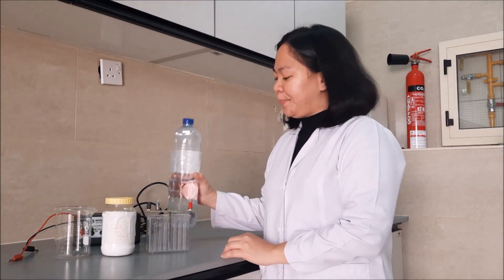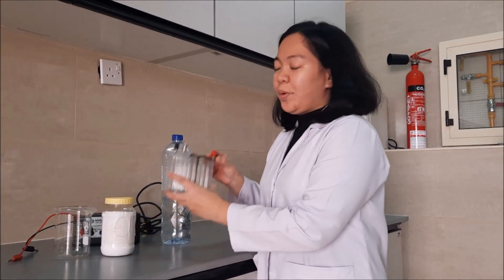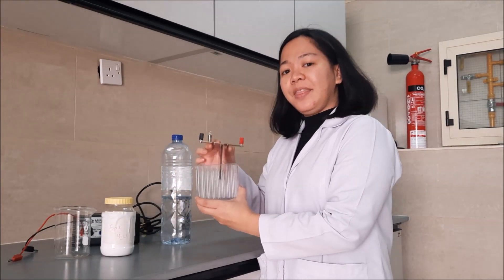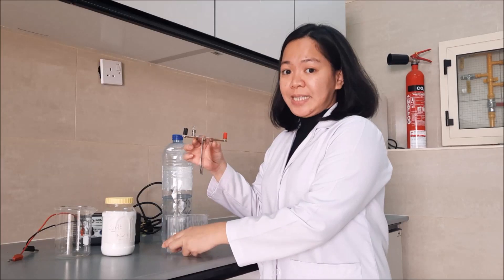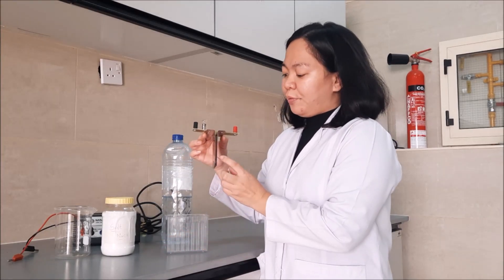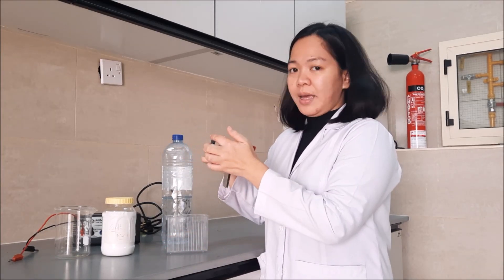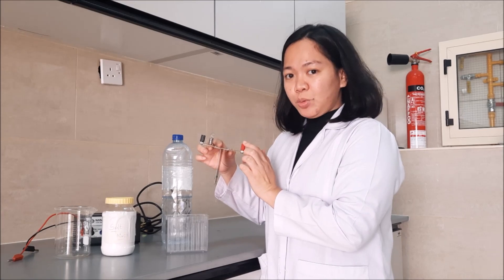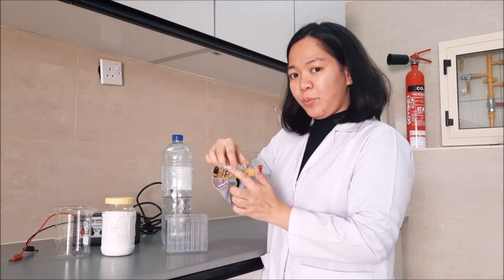We need distilled water, we need a container, and this is an electrolysis demonstration kit. We have two metals here and the one that we will attach with the electricity, and we have a lamp.